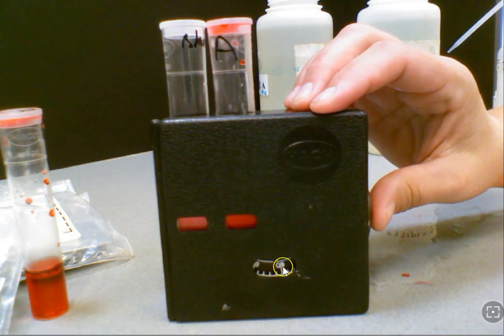And once that happens you will read at the needle here your final results, and that will be in milligrams per liter, and you will report that to your data collector for your group.